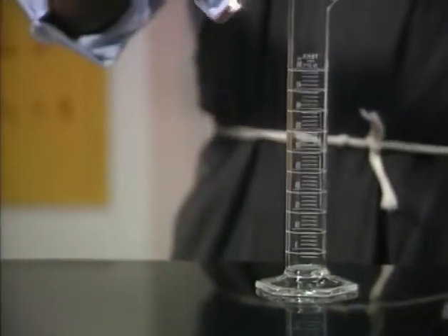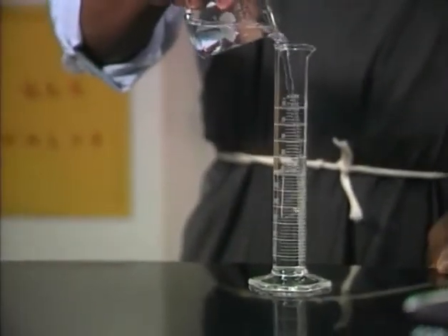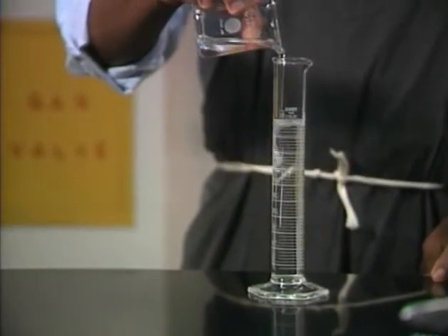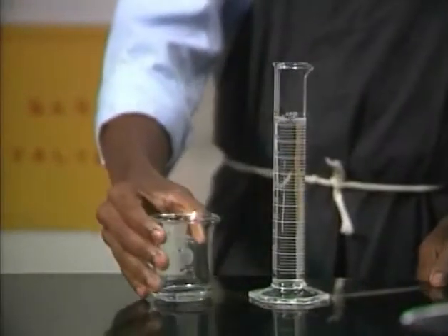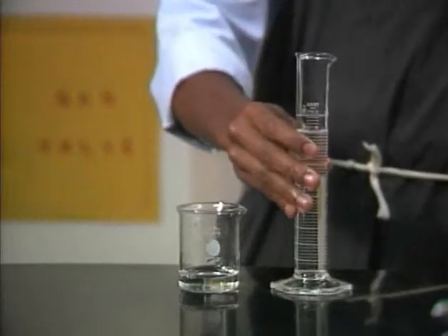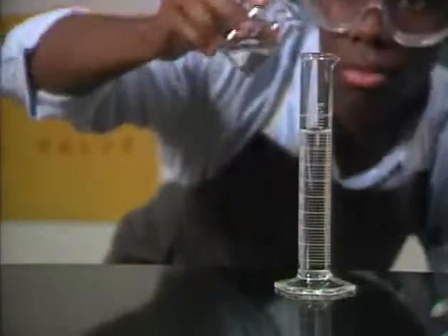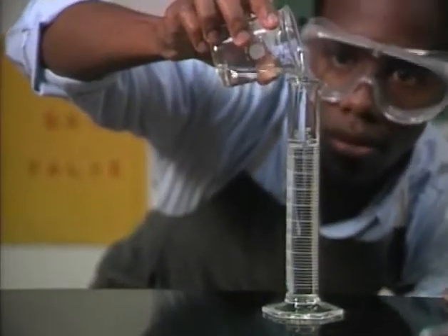Set bottles out of the way when you're finished so they won't get knocked to the floor. When handling chemicals, always keep them away from your face. Never taste anything to see what it is, and don't touch it or smell it directly from the bottle either. Small amounts of some chemicals — even vapors — can harm your eyes, mouth, and nasal membranes.